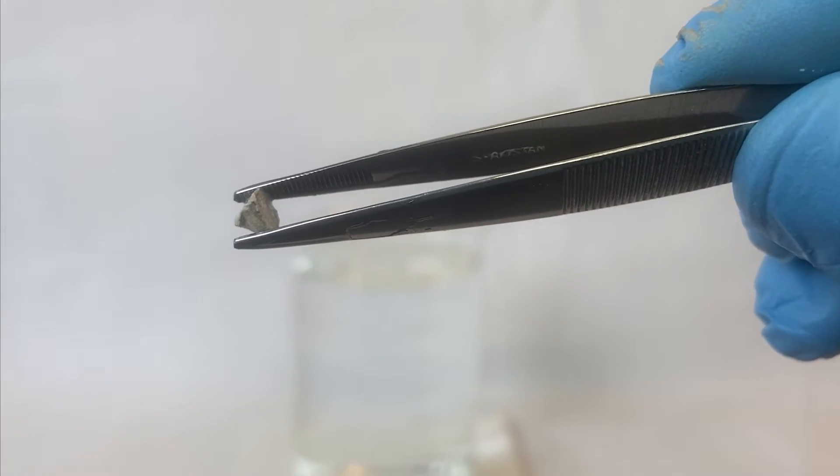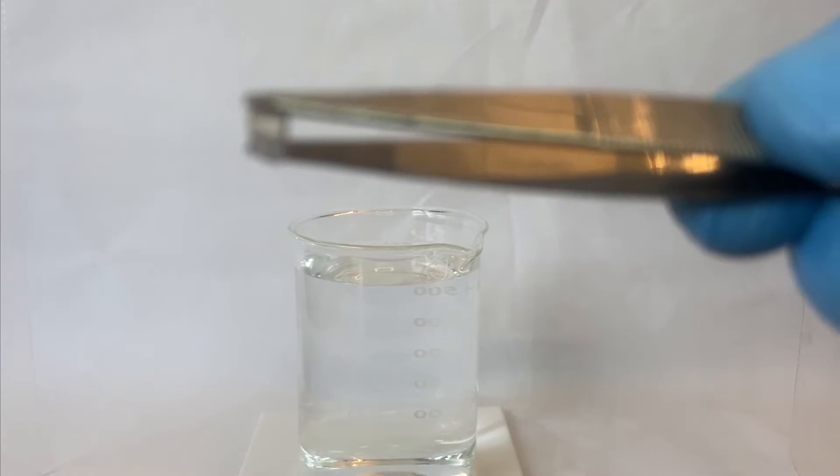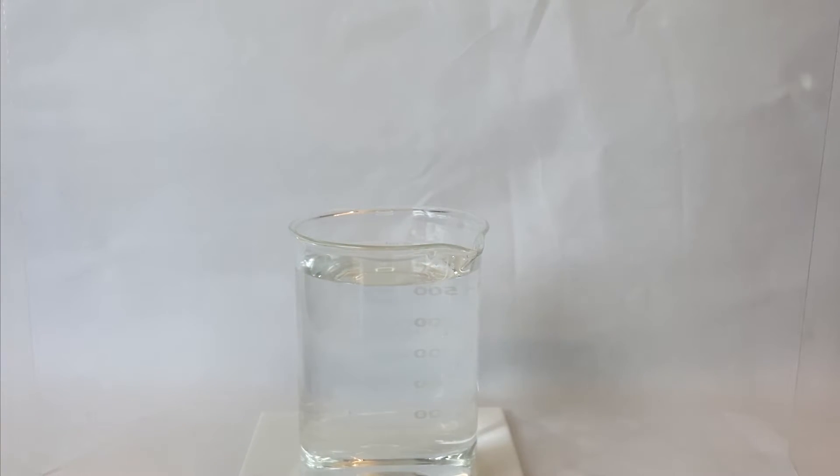Again, low density metal, very soft. Let's add the sodium to the water and see what happens.